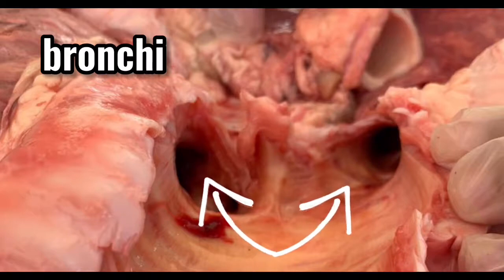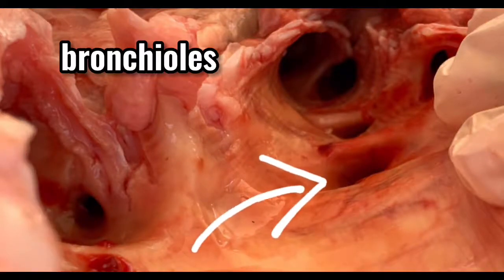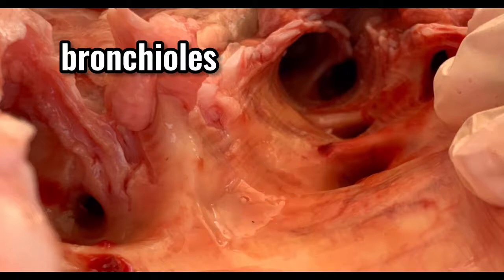They function primarily as a passageway for air to travel back in and out of the body. Bronchioles. This structure is connected to the alveoli. They are air passages inside the lungs that branch off like tree limbs from the bronchi, the two main passages into which air flows from the trachea after being inhaled through the nose or mouth.